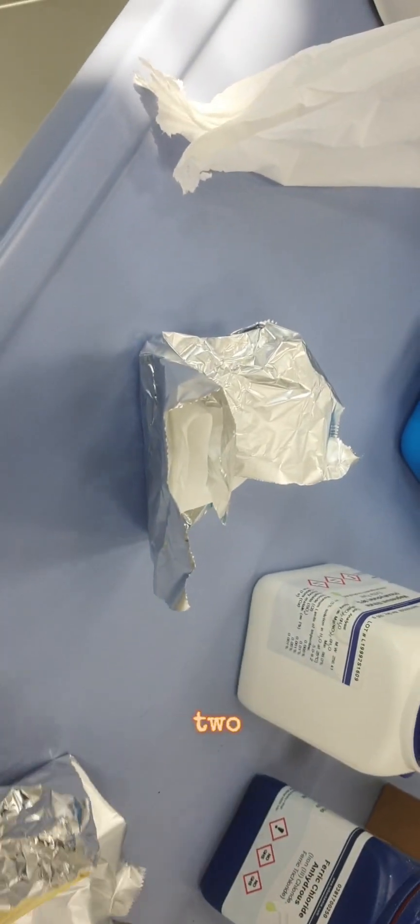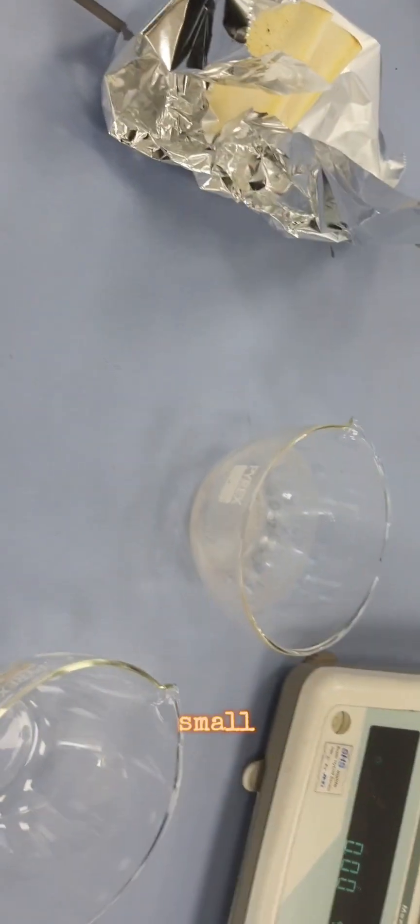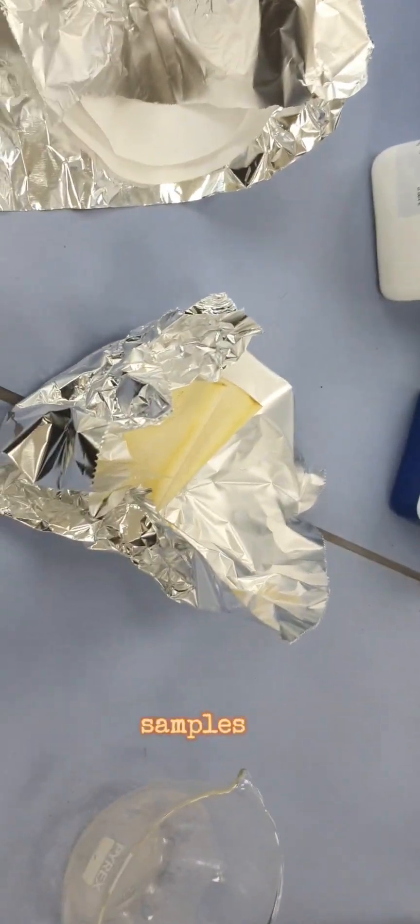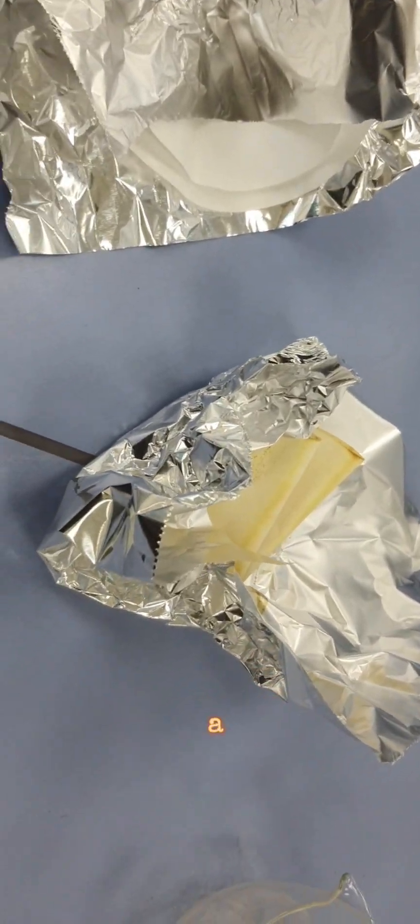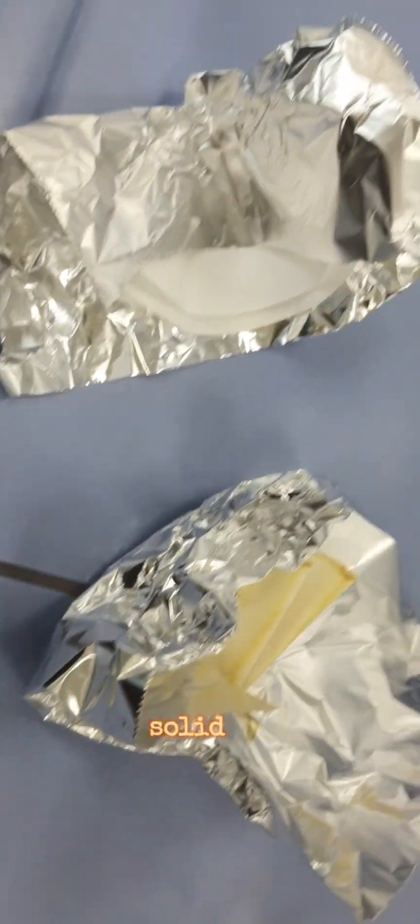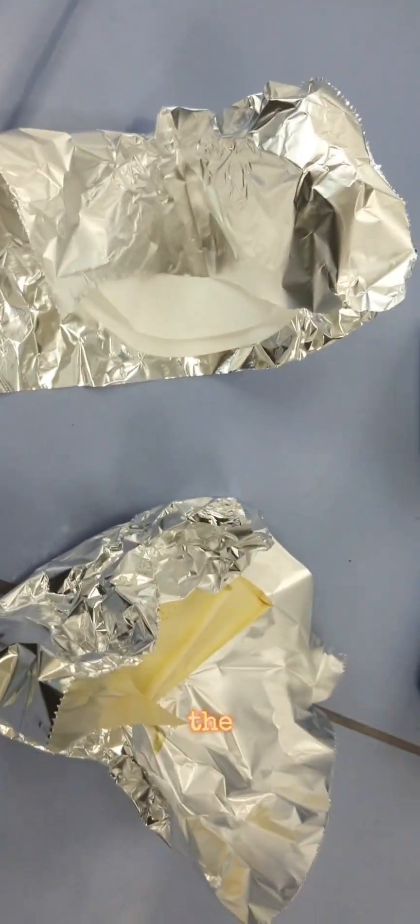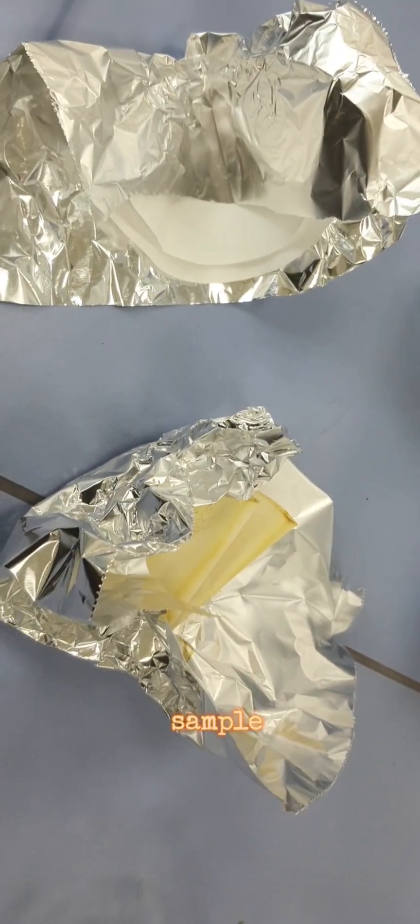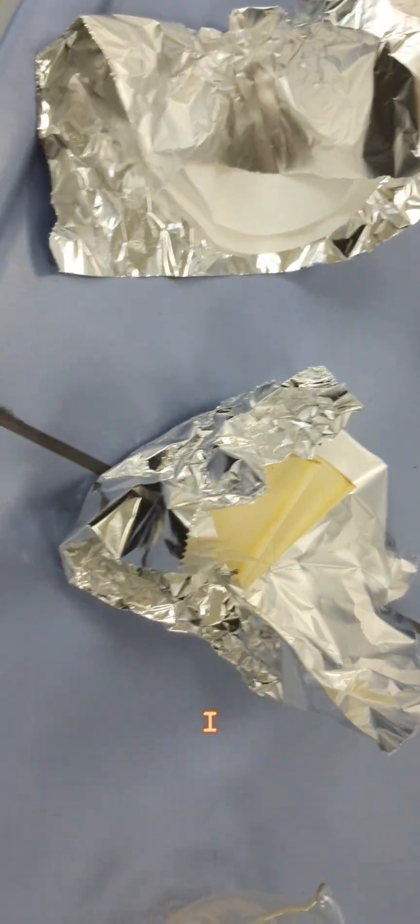I've taken two samples. Here is the one which has a high amount of solids, and this is my second water sample.